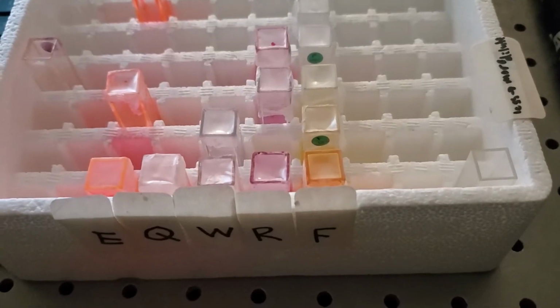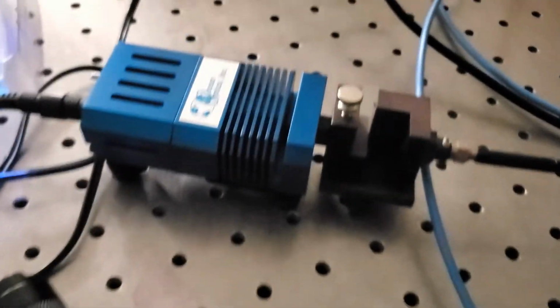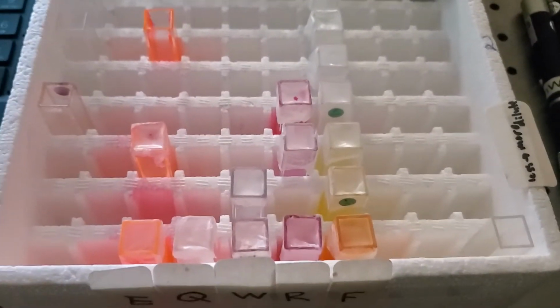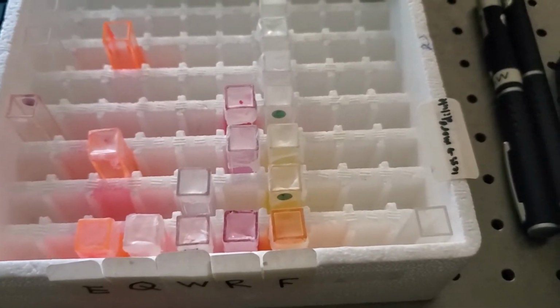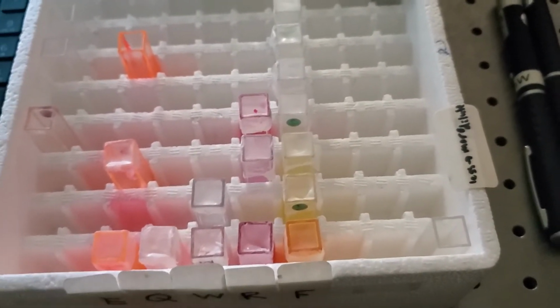So now at this point, I'm going to take each one of the dyes separately, and I'm going to illuminate it here with the different light sources to see what's going to cause more fluorescence. And my hypothesis is that anything closer to the UV or to the violet end of the spectrum is going to cause more fluorescence than anything closer to the red part of the spectrum.